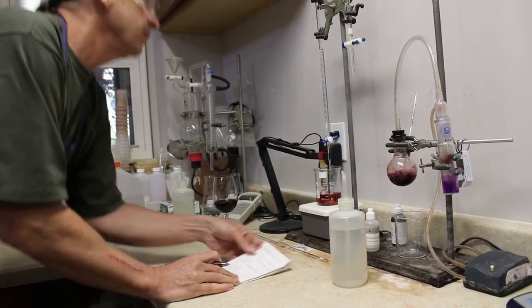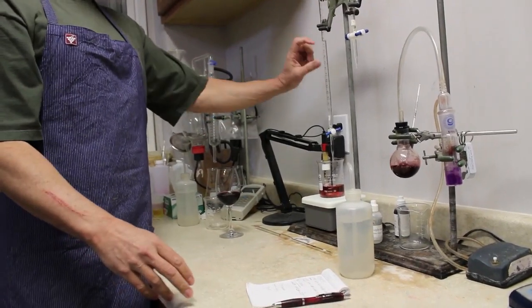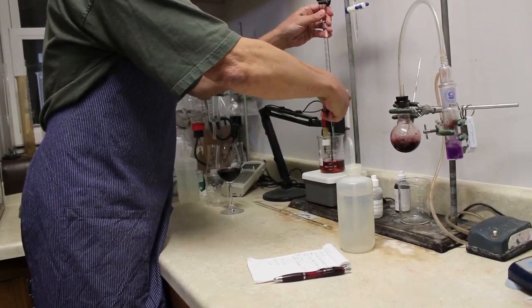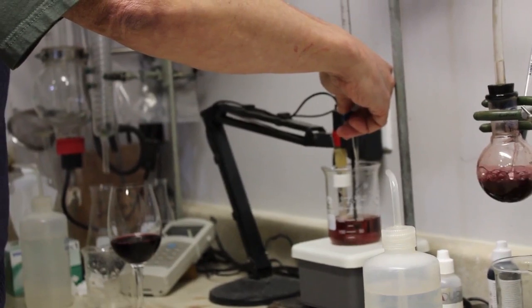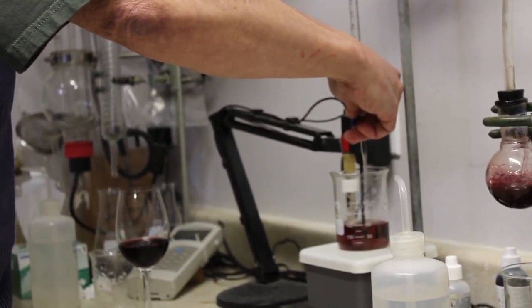13.2 milliliters, and then I will titrate till my endpoint of 8.2, and then the difference will give me my amount of acid using a formula. It takes a lot up front, and then you start having to finesse it one drop at a time to make sure you catch it.